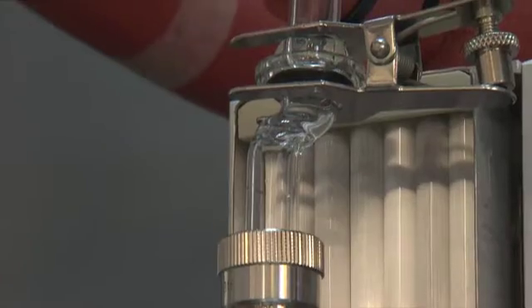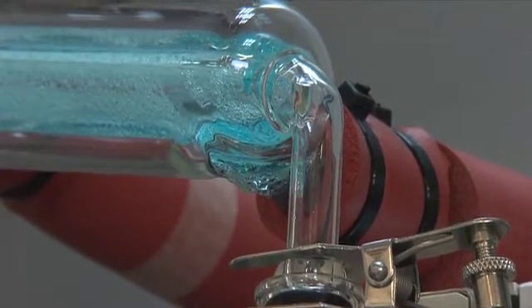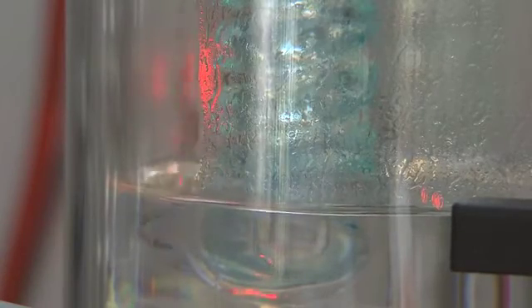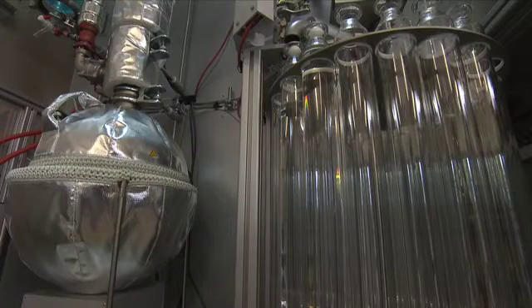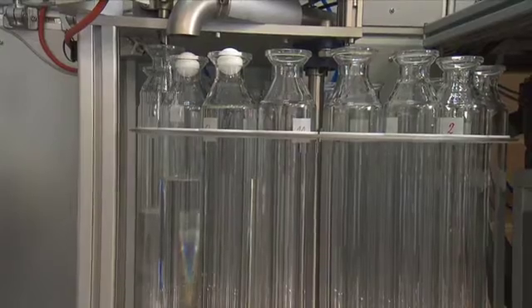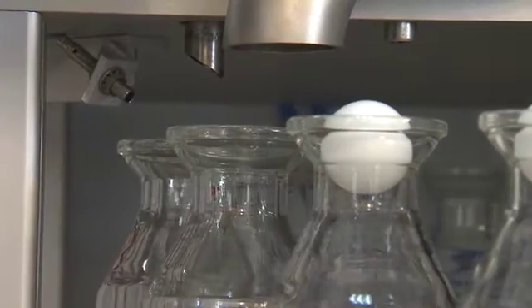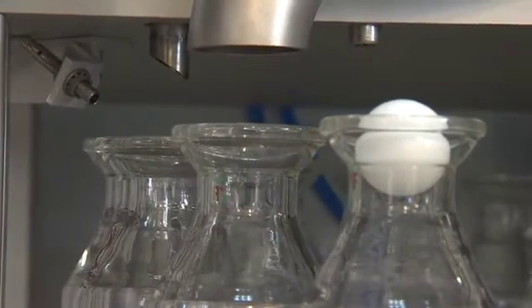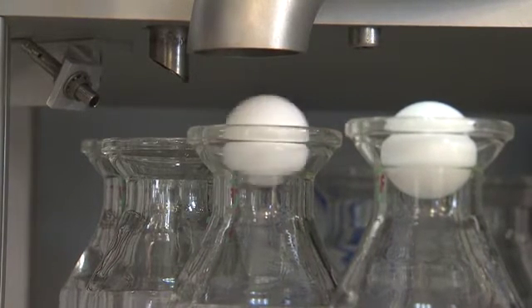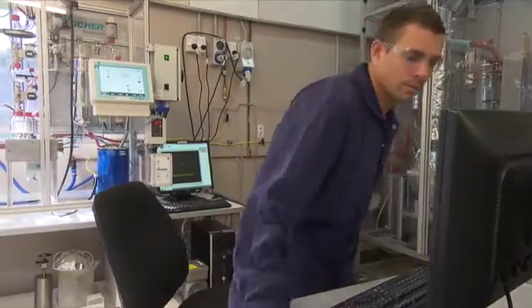The distillation process will begin under atmospheric pressure, starting with a debutanisation step which collects up to C4 hydrocarbons. It will continue collecting defined cuts at atmospheric pressure up to a temperature of 200 degrees Celsius. After this, it will switch to vacuum mode, continuing the distillation and collection of cuts at a series of different vacuum pressures ranging from 100 Torr to 0.1 Torr. For each cut, mass and density data is obtained and used to calculate the yields of each different cut. From this, a true boiling point curve, or TBP curve, is established.